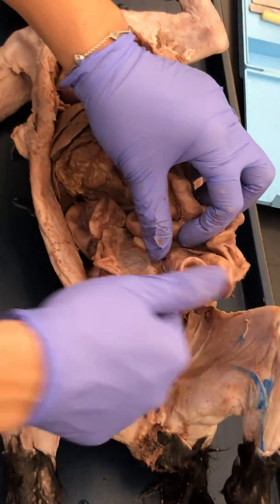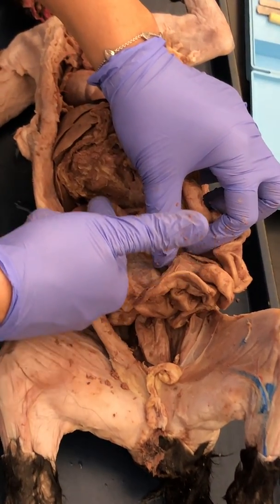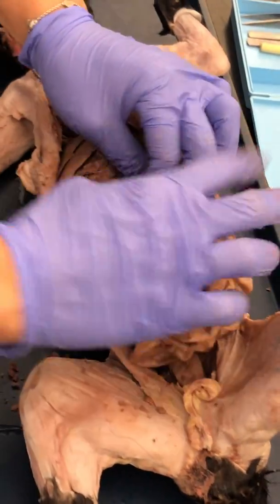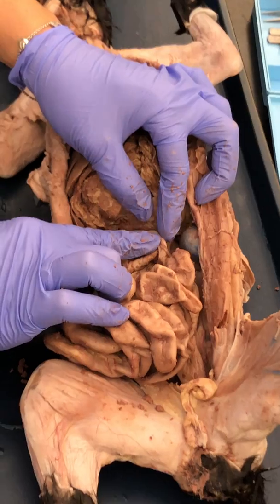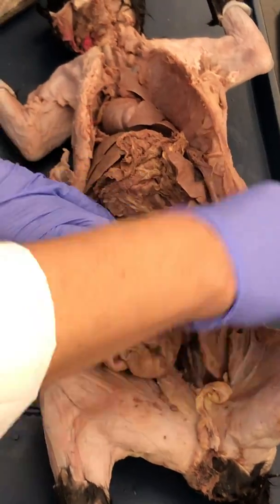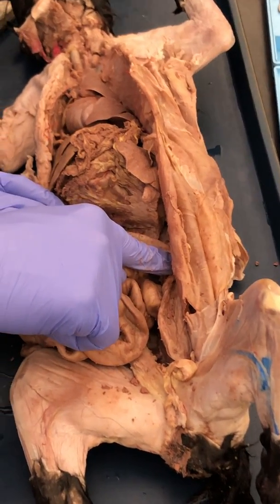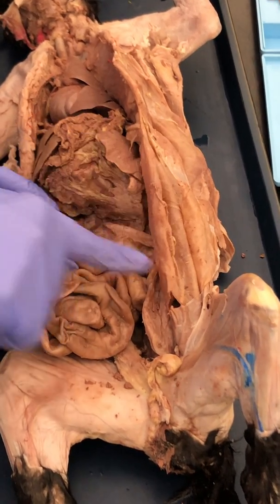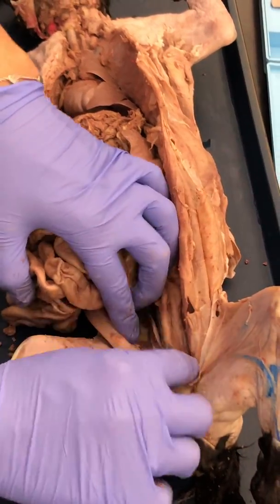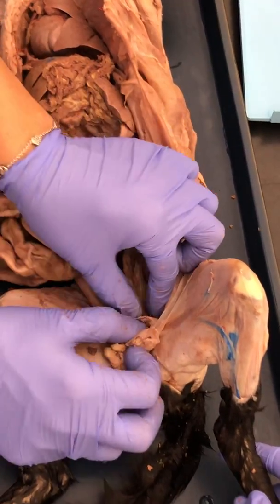If we move them out of the way, here we've just started the large intestines. They go up, that would be the ascending colon. Okay, that's this one actually right here. Ascending colon, then it turns, that would be the hepatic flexure, and then it goes all the way across, right? That's the transverse colon, and then it turns. The turn is the splenic flexure because it lies right under the spleen, and then it descends, so that would be the descending colon.